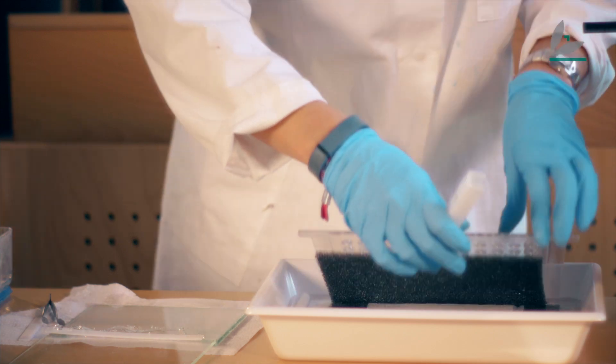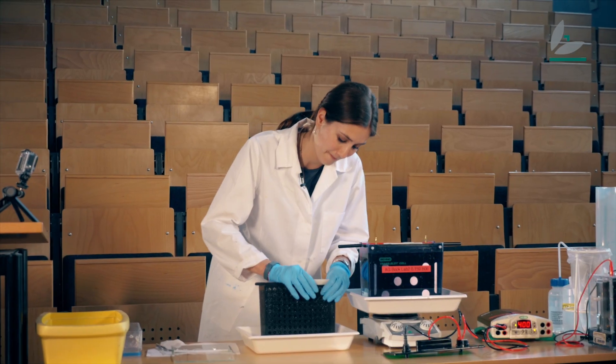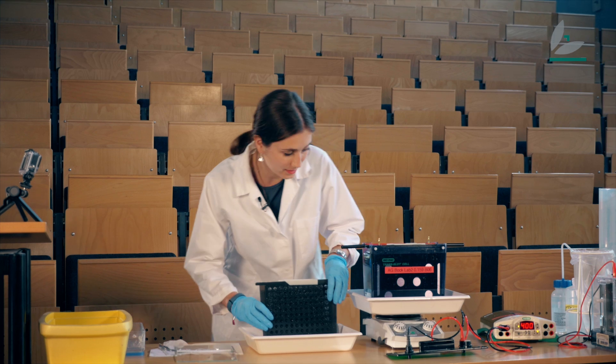And we finish the sandwich, as it's called, and put it in the box.